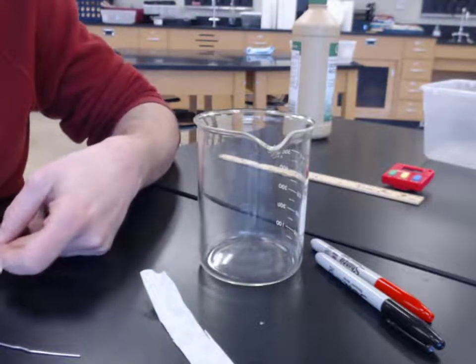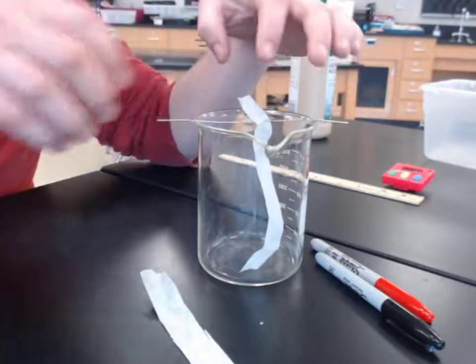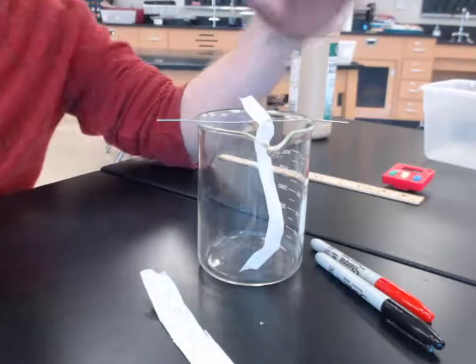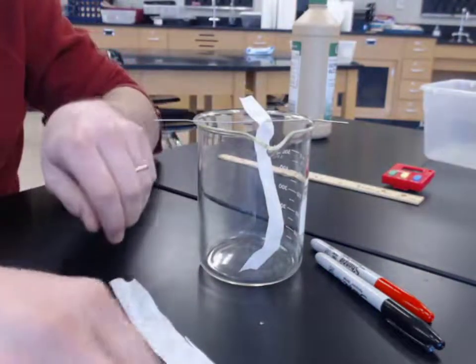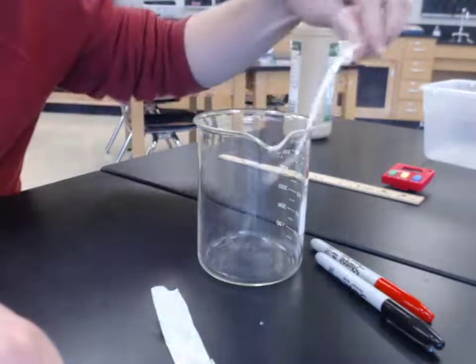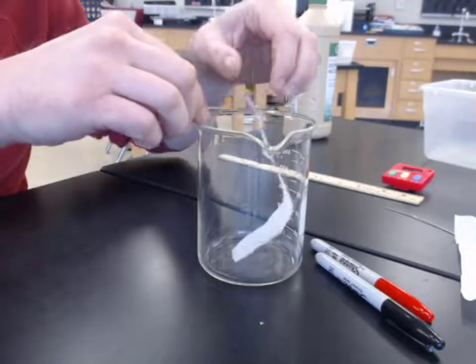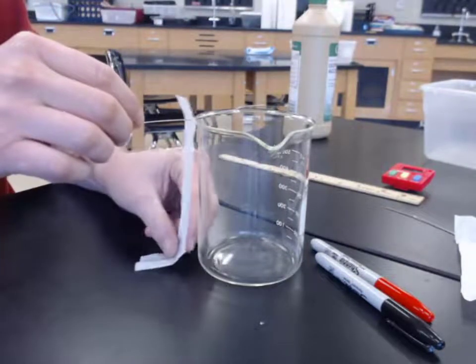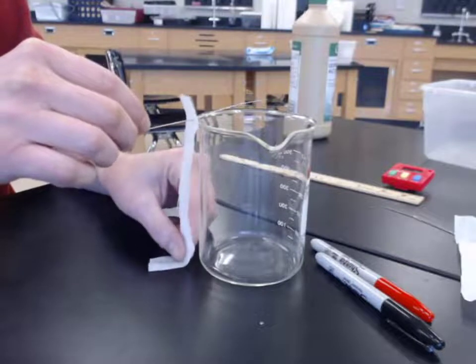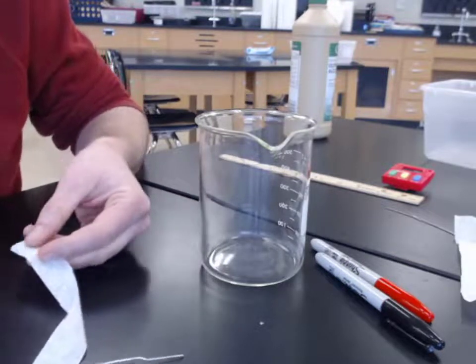See what we're looking at here. All right, put it back in. And that looks like we're just about touching the bottom. So that one looks all right. Our other one, down here. Okay, so that one needs a little bit trimmed off as well. We'll go with, let's say, about 1.5 centimeters of that one.